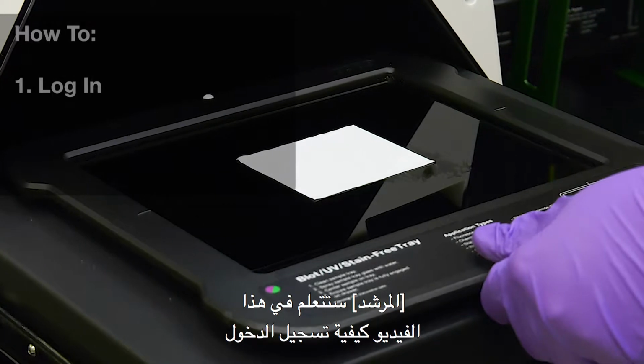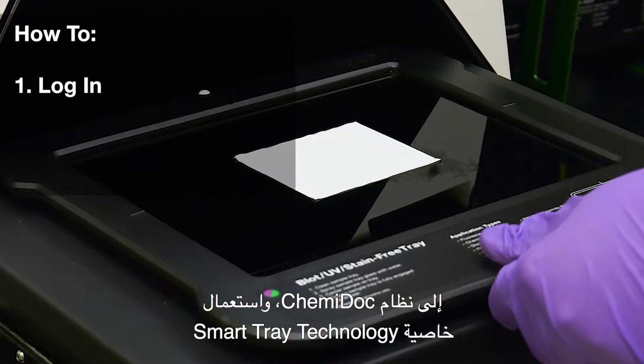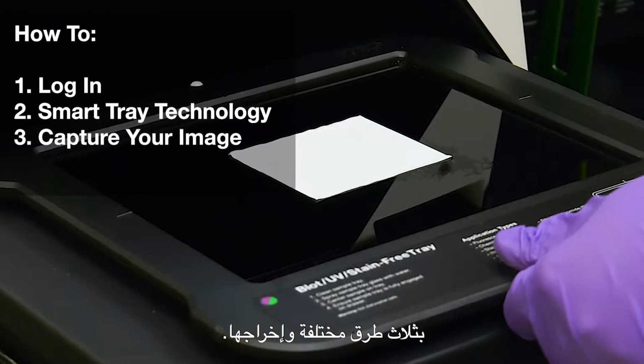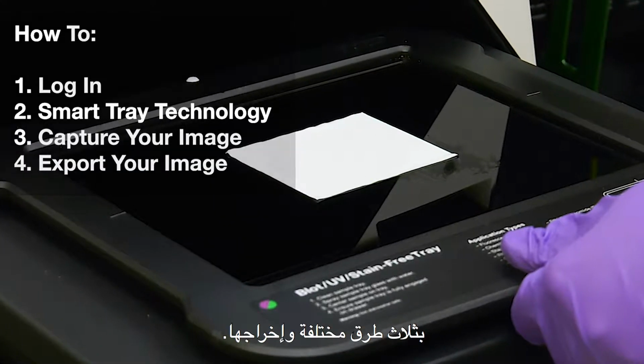In this video, you'll learn how to log into your ChemiDoc, use Smart Tray technology, and capture chemiluminescent blot images in 3 easy steps and export them.